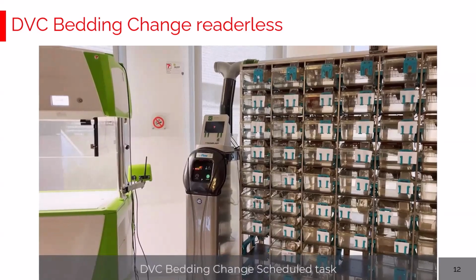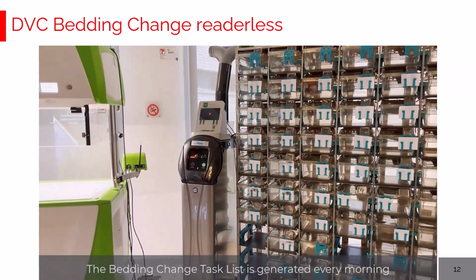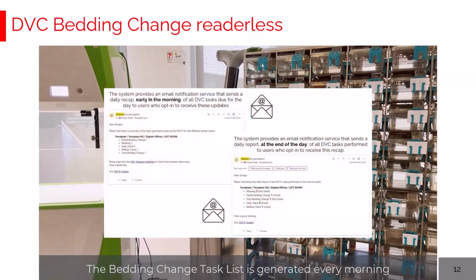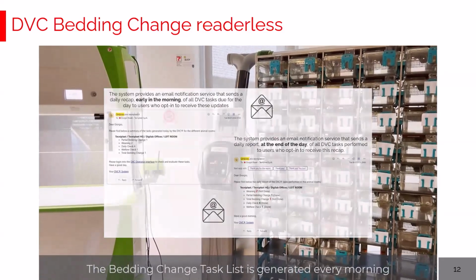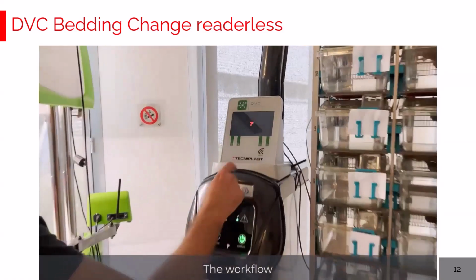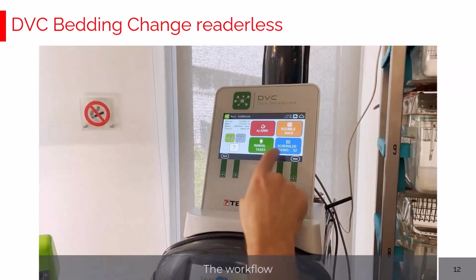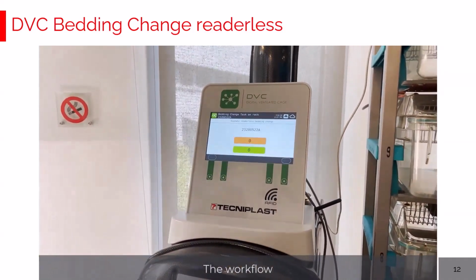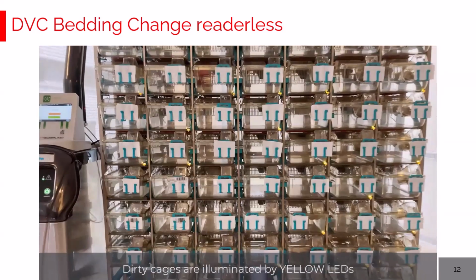Let's talk now about the scheduled bedding task. As said, the DVC every early in the morning can create a list of dirty cages to be changed. How is the workflow? Very simple. The operator arrives in the morning, clicks on the rack, clicks on scheduled task, and there are a total of 19 dirty cages to be changed.